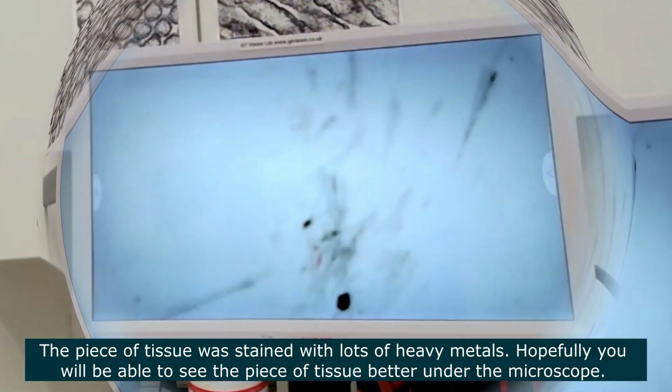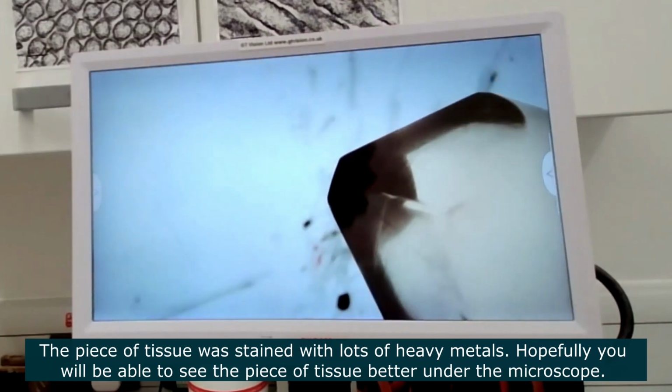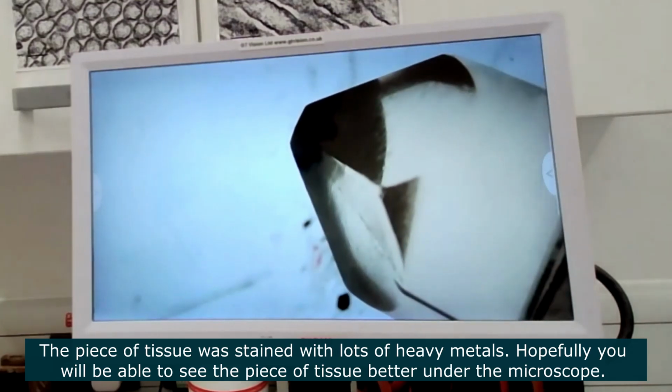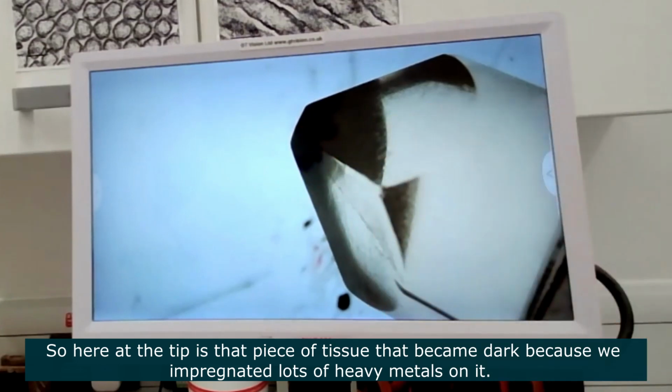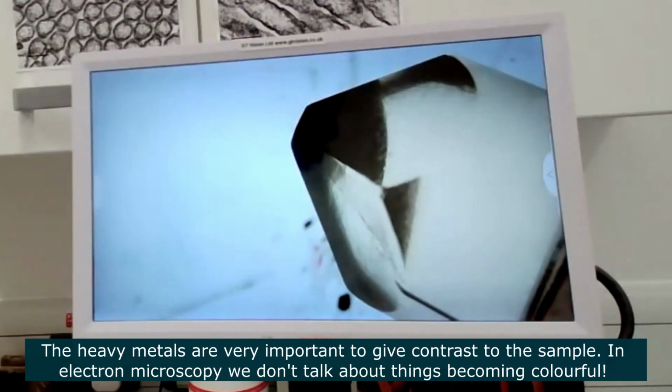The piece of tissue has been stained with lots and lots of heavy metals, and hopefully you'll be able to see better on the microscope here the piece of tissue stained. Let me see if this light helps as well. So here at the tip, this dark spot, that's that piece of tissue that became dark because we have impregnated lots and lots of heavy metals on the piece of tissue, so it's dark. The heavy metals are very important to give contrast to the sample.